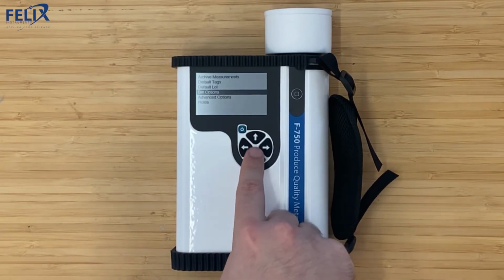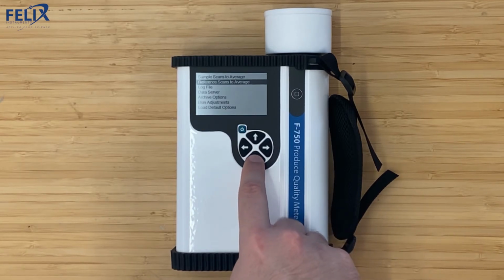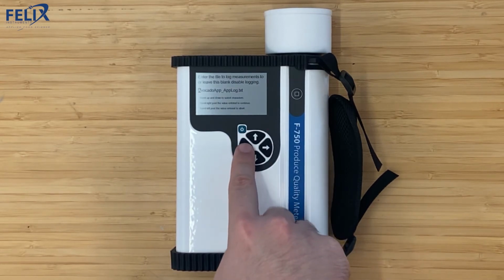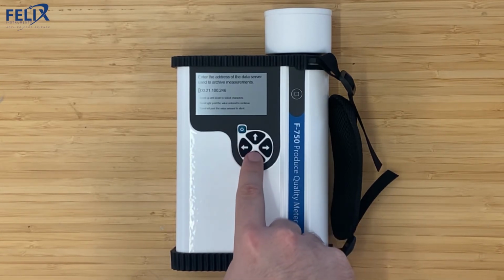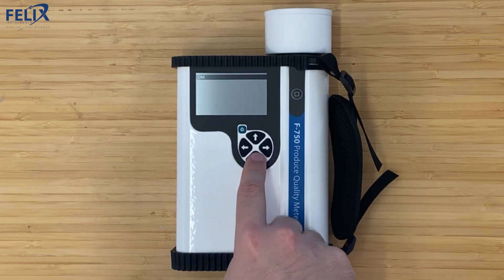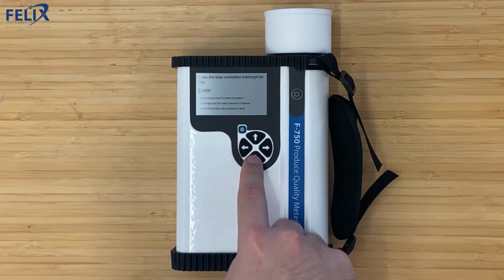We also have an advanced options menu. Here you can change things like the scans to average for the sample and the reference. You can edit the text file that is actually created with all of your data. You can upload to a data server by inputting the IP address there. You can also adjust the bias for the various models. So for the dry matter model, you can change the intercept by clicking the right arrow on the intercept, and then we can also change the slope if need be.